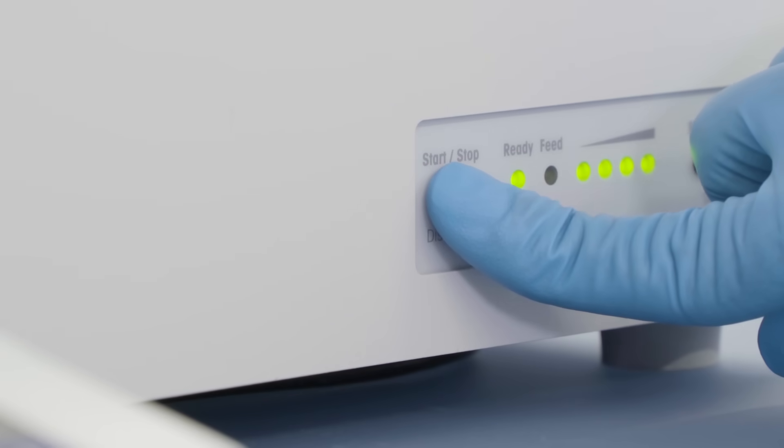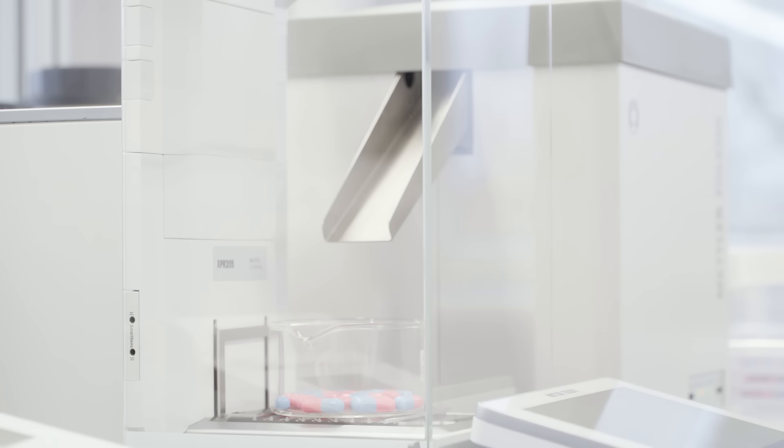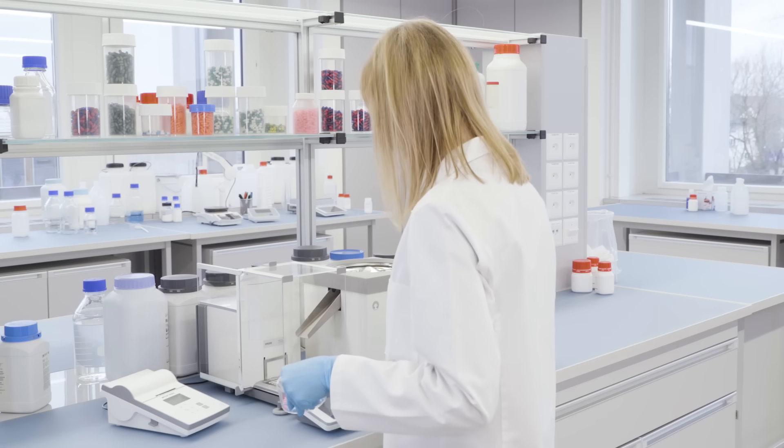Simply press and hold the button to empty the LV12 feeder and you're ready to start the next test.